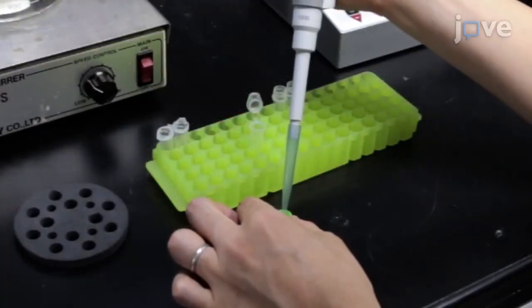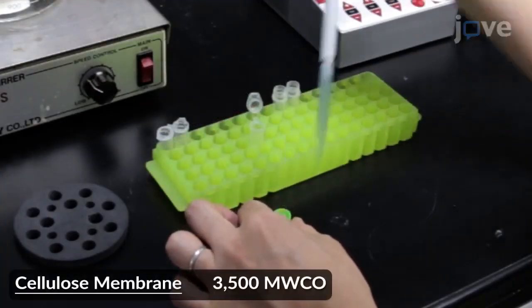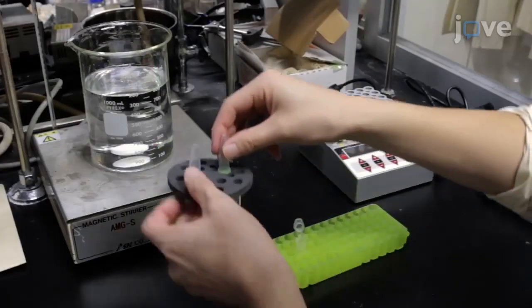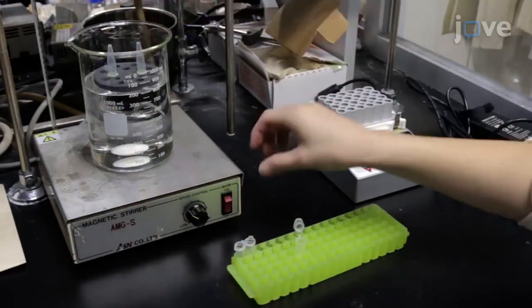Place the resulting solution in a regenerated cellulose membrane and dialyze it for 24 hours against 800 milliliters of DMF.